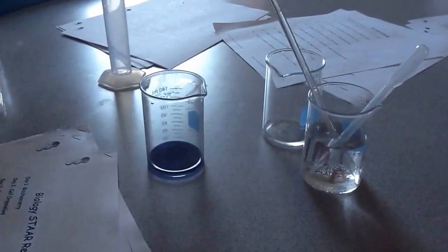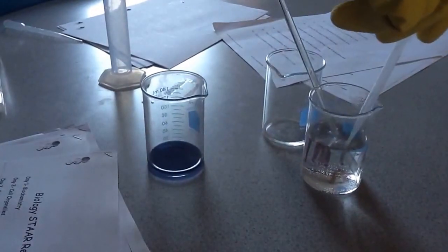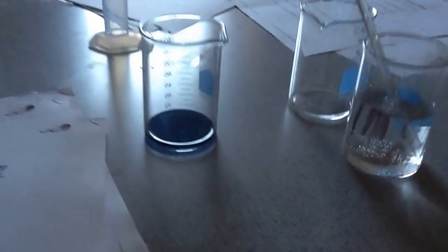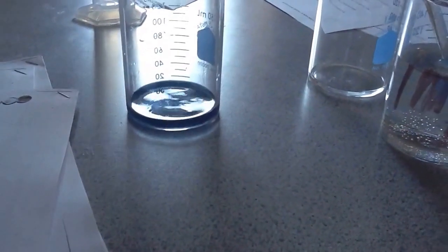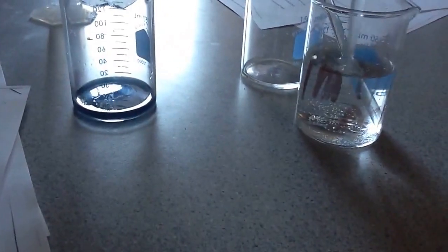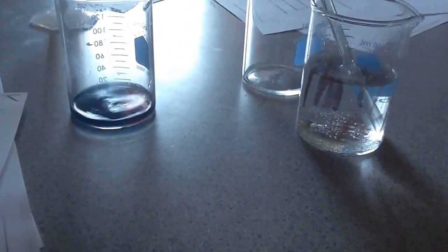As I add my acid to it, watch the color change. It's a very similar lab to yesterday. You can actually see it getting clearer. You see a little reddish? It's a little hard to see.